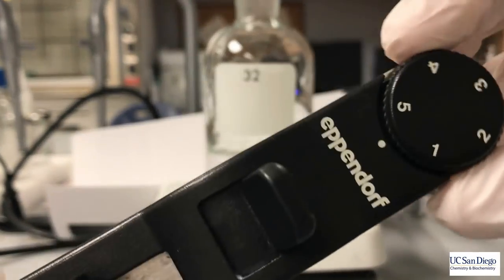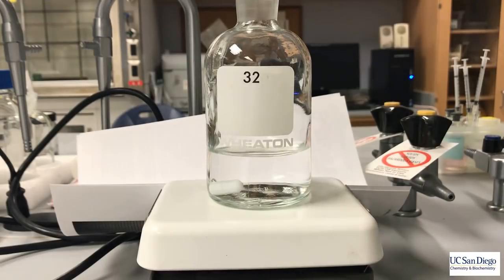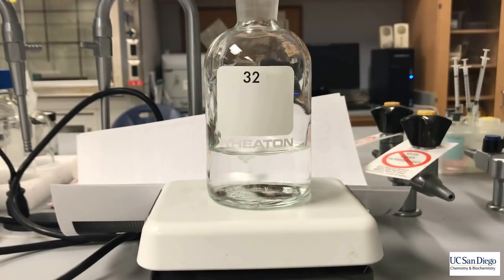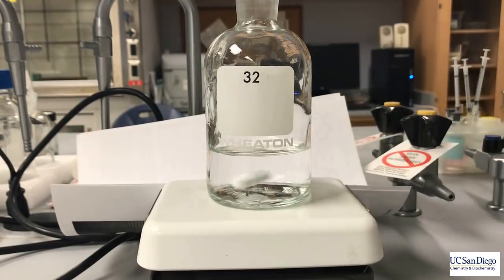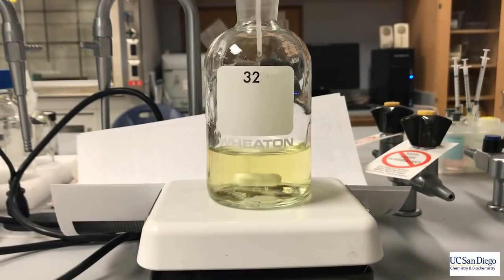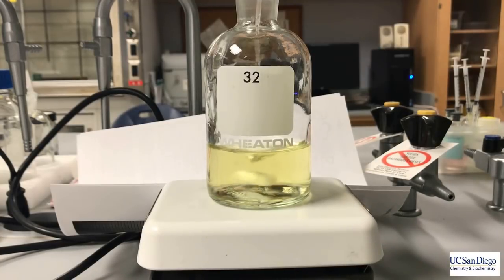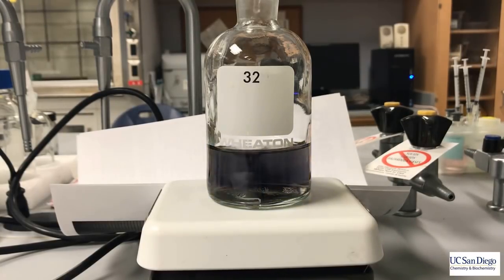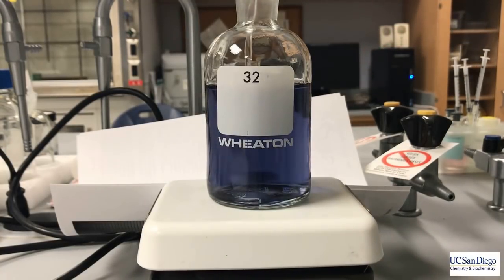Now what we're going to be doing is the blank titration. This is going to allow us to determine the effects that our reagents have on our determination of the oxygen content. We're going to be reducing the volume of each addition to about one milliliter or one gram. The key thing to remember about the blank titration is that we're going to have to mass our titrant pipette a total of three times: once before the titration, once after the titration of the first addition of potassium iodate, and once after we titrate the second addition of potassium iodate.